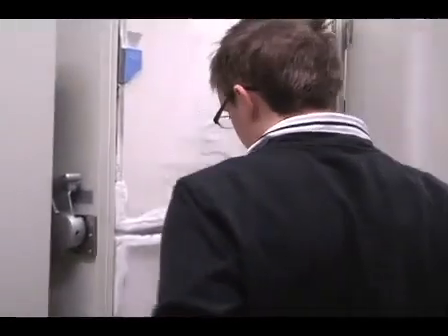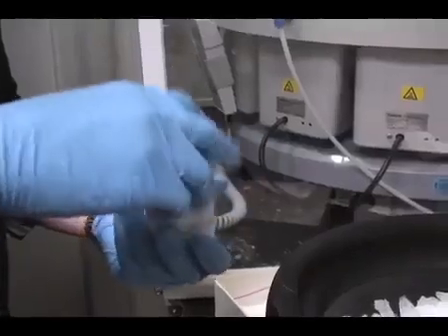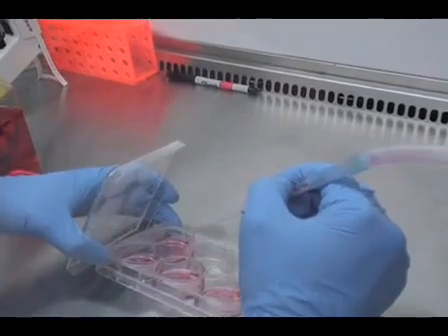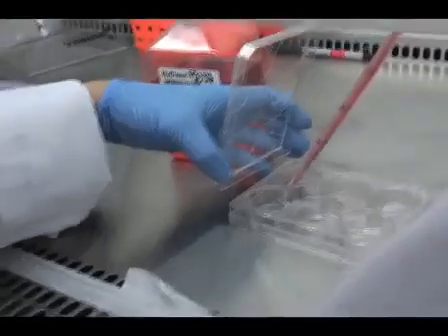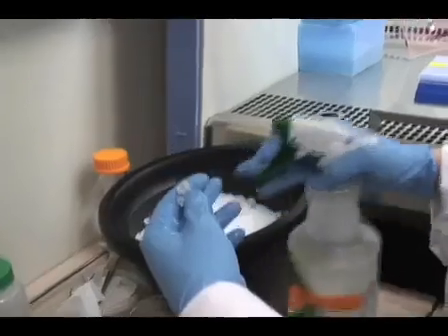The adenovirus that we obtained from Vector Biolabs was aliquoted and stored at -80 degrees Celsius. Retrieve this virus and return to the flow hood. Remove the 6-well dish from the incubator and bring it to the hood. Aspirate off the media and wash the cells with 1 ml of serum-free DMEM. Now add 1 ml of serum-free media to each well for the addition of the virus.